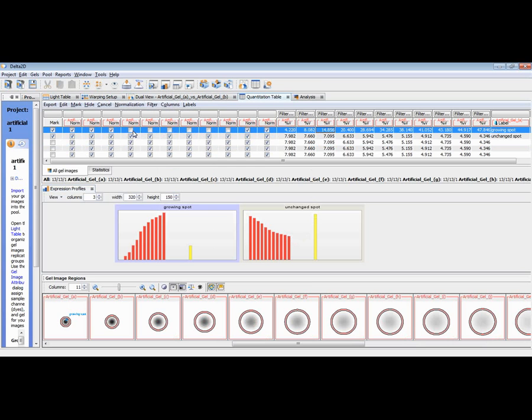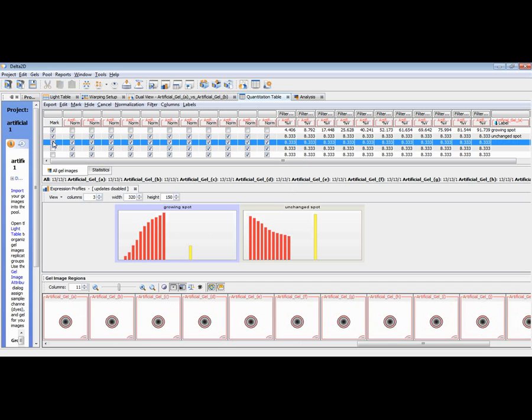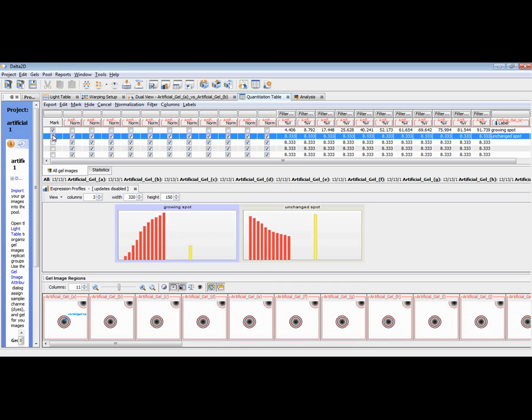So let me exclude this again, and then we come back to our normal spot volumes, and let me show this here. Just a second. It doesn't update this view now. Okay, here we go. Now this unchanged spot is unchanged again, and the growing spot shows this growing spot quantity.